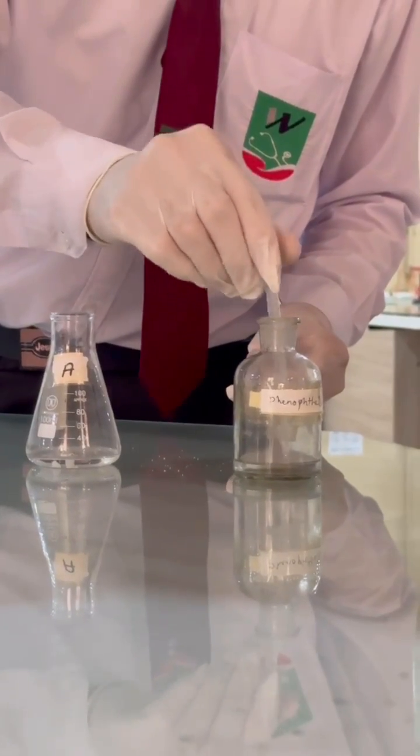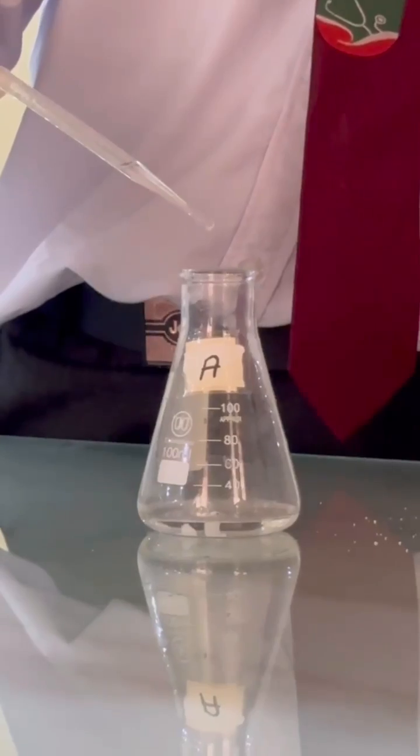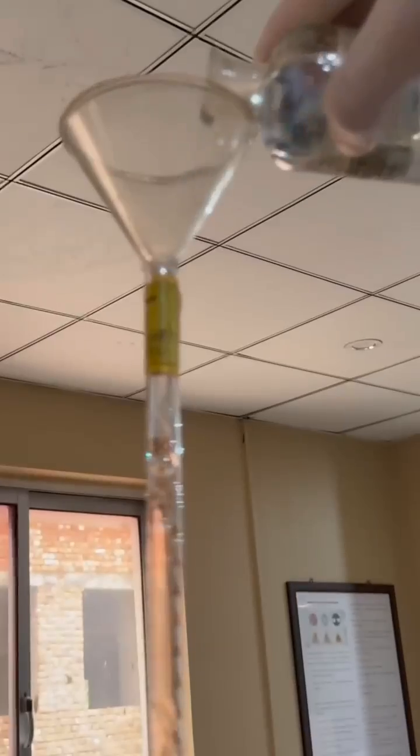Add 1 to 2 drops of 1% phenolphthalein. Mix thoroughly by vigorous shaking for 1 to 2 minutes.